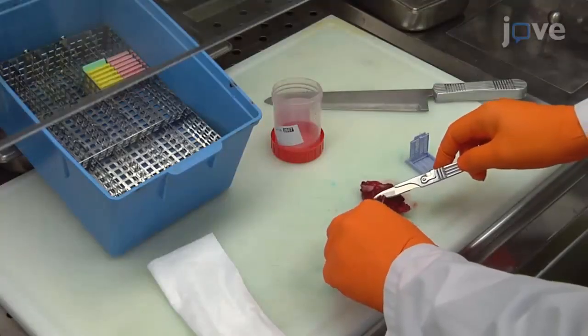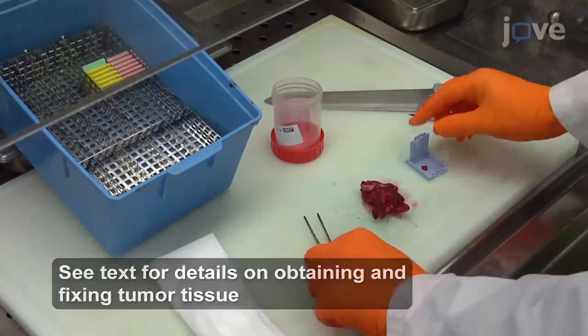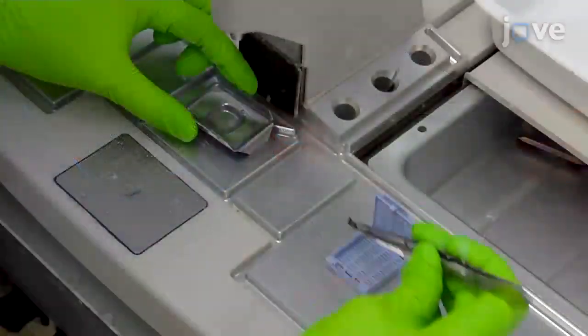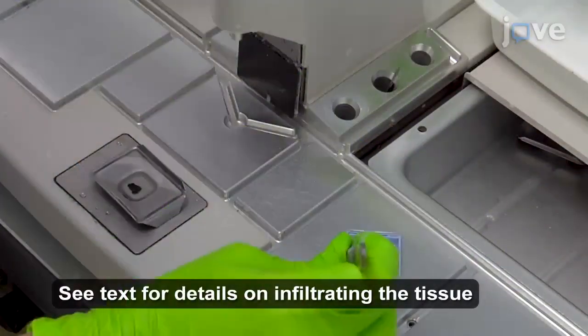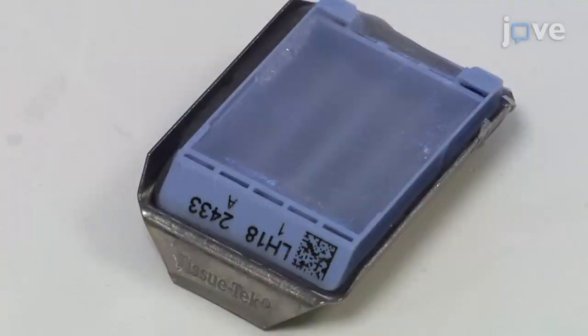To begin, fix the tumor tissue in 10% neutral buffered formalin in a cassette and embed the cassette in paraffin as outlined in the text protocol. Embed the infiltrated tissue inside a mold that is filled with molten paraffin. Let the tissue stay in the mold until the paraffin has solidified.